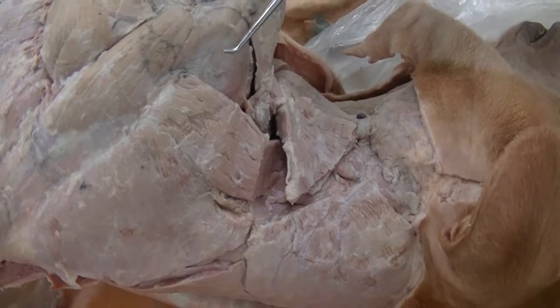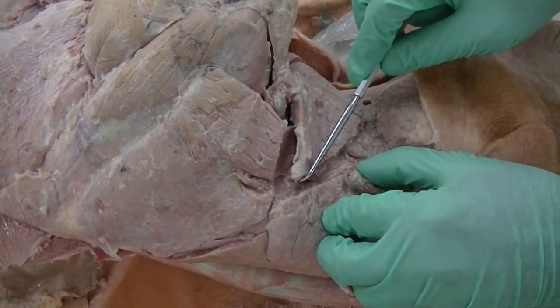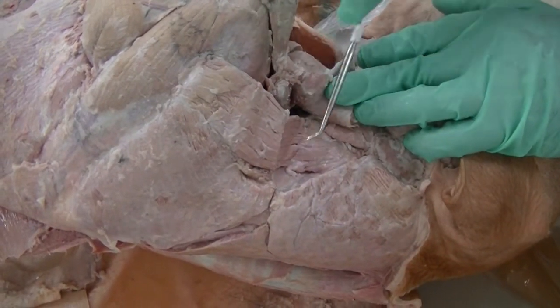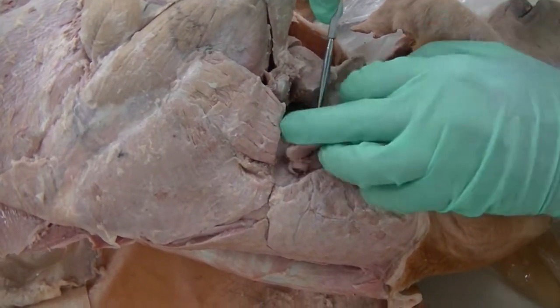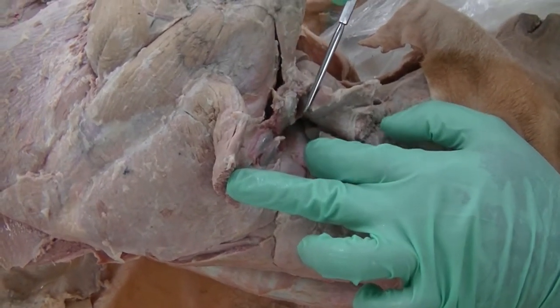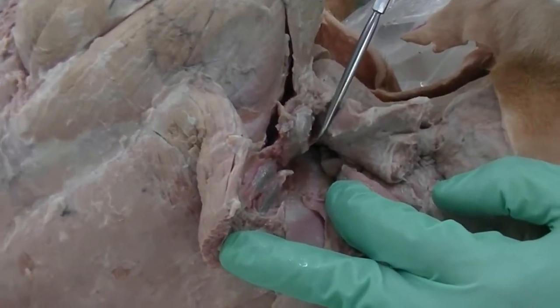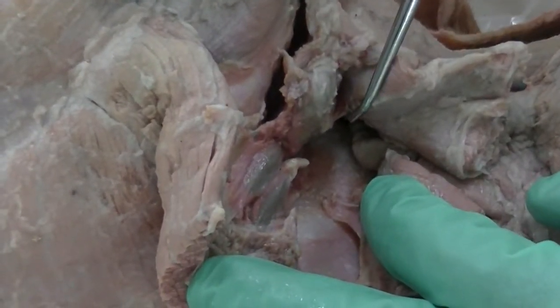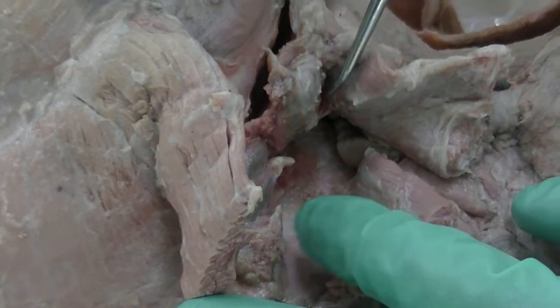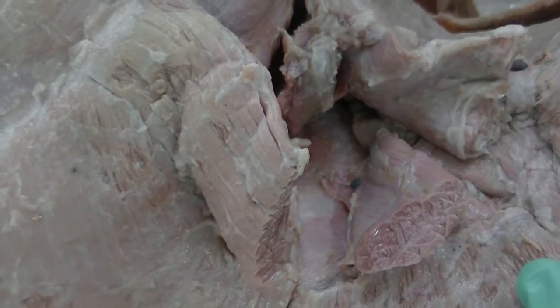Along with the extrinsic muscles of the forelimb, as we transect the brachiocephalicus and expose the omotransversarius muscle. After transecting the omotransversarius, you will also find the superficial cervical lymph nodes, which are located in this region. The superficial cervical lymph nodes, which are also known as prescapular lymph nodes, are responsible for draining the head, neck, and the entire forelimb.